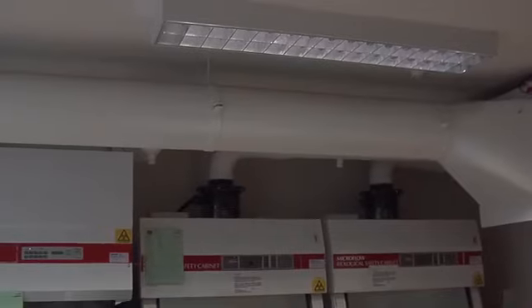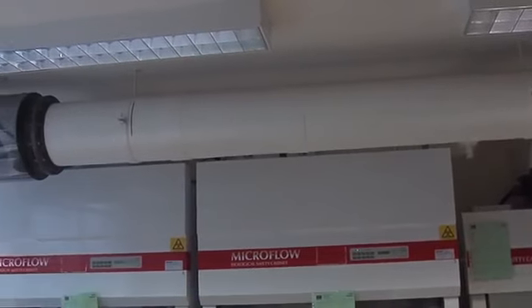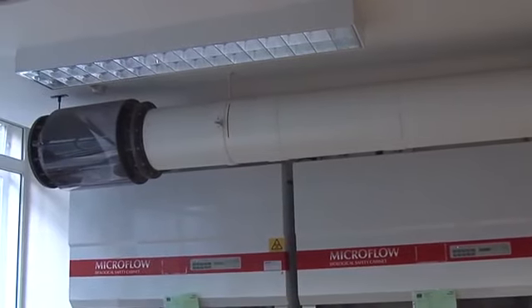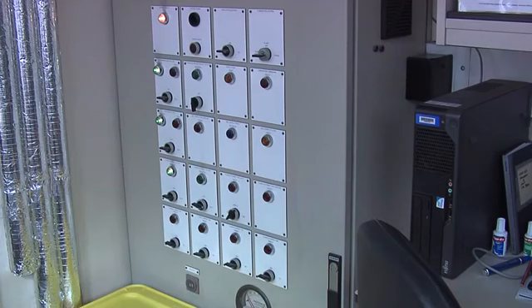The Containment Level 3 laboratory is a self-contained laboratory unit maintained at an air pressure negative to the atmosphere, that is, at negative pressure, for optimum continuous inward airflow. The negative pressure is achieved using a dedicated air supply and air extract system. The air supply system will alarm if the negative pressure in the room is not maintained.